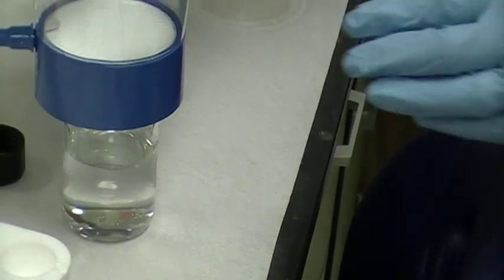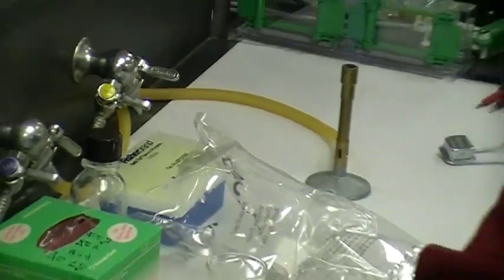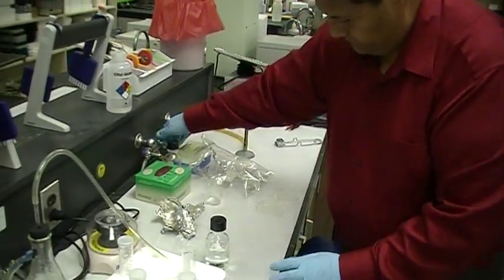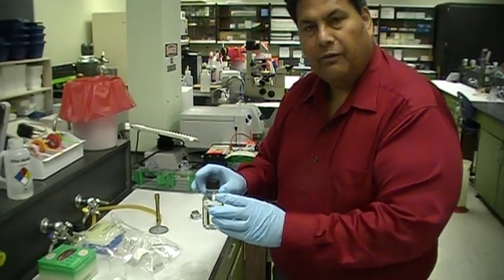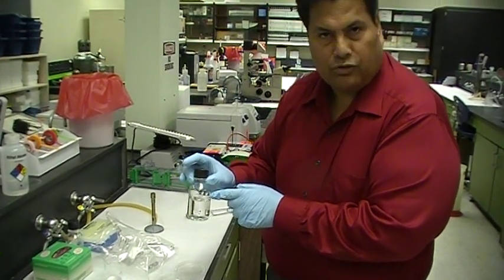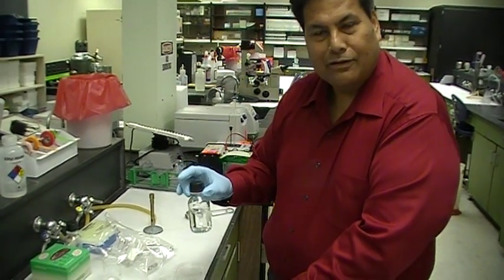When you finish, you take this off, get rid of this in the biohazard bag, turn off the vacuum, put the lid on, turn your gas off, and clean up. Now, you're going to put a tape on here to label what solution it is, and you always put your initial, put the name of the solution, its concentration, and then put a date so you know how old that solution is. And that's all there is to it. Thank you very much.